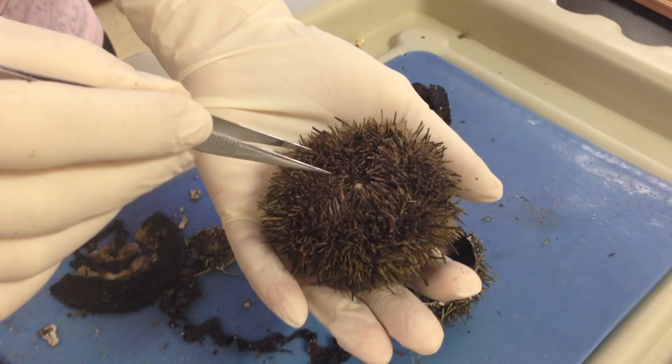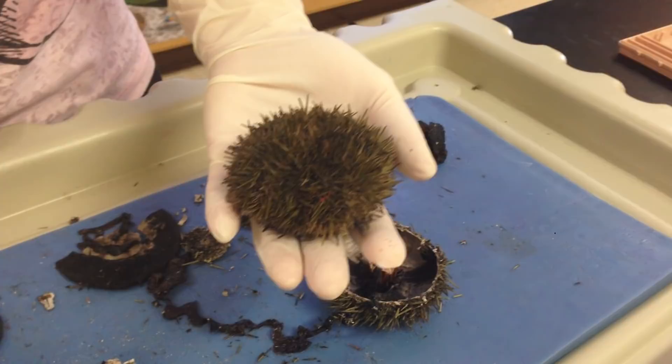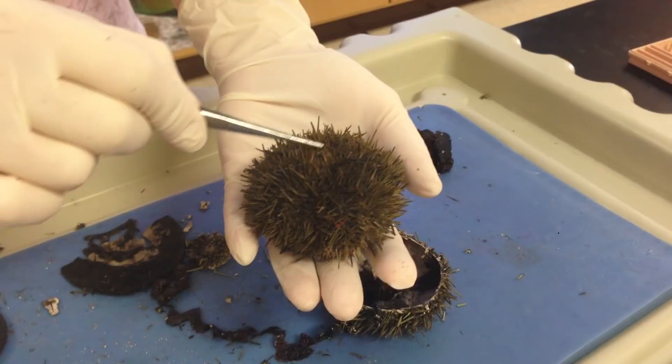If we flip it back over and we're looking at the opposite side, which is the ab-oral side, this region here has an area called the periproct. If you were to go to a doctor called a proctologist, that means they work with the rectal area, and this, of course, is where you're going to find the rectum as well.